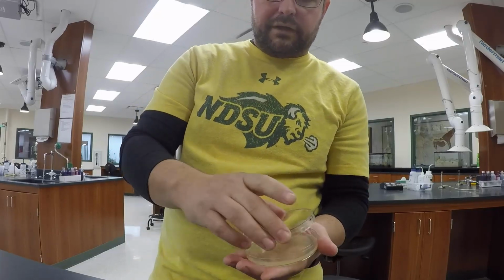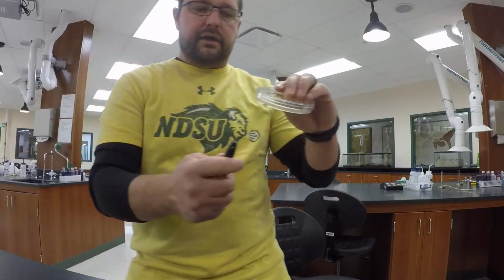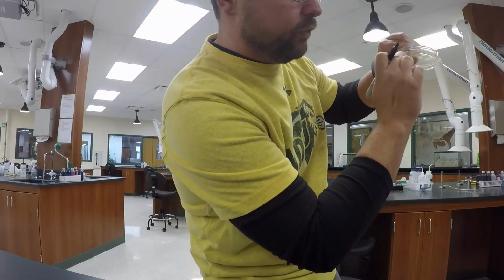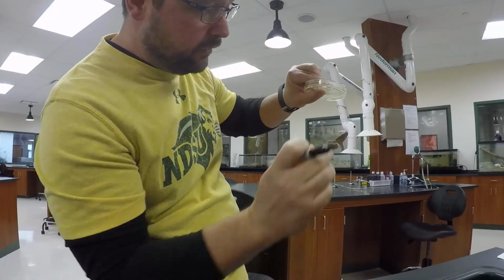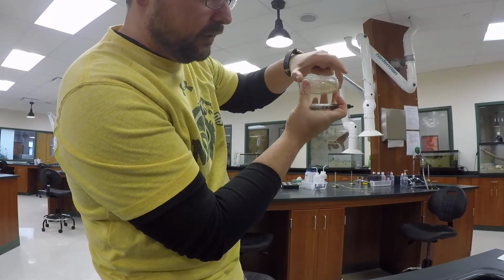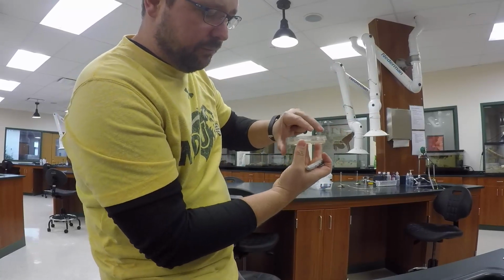That's been inoculated. So now I'm just going to put the cover on right on here, on the edge of the plate. So note that I'm writing on the edge where the nutrient agar is. Okay, so the bottom of the dish, because the top, the lid, can spin. So you don't want to really write on the lid of a Petri dish.